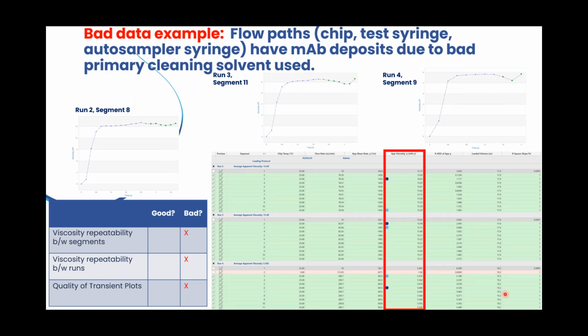So continuing with the presentation. My colleague Sohila was explaining about the best practices for cleaning your samples. So I'd like to go over what happens when you use a bad cleaning solvent. Here we show an example of what happened when one of our customers was using a bad primary solvent. So in this case, they were running protein samples, and their primary solvent, so this is the solvent that was used to directly displace their solution from the chip, was a buffer that was not a good solvent for their mAb proteins. So what happened with their instrument and their data? So this is what happened.